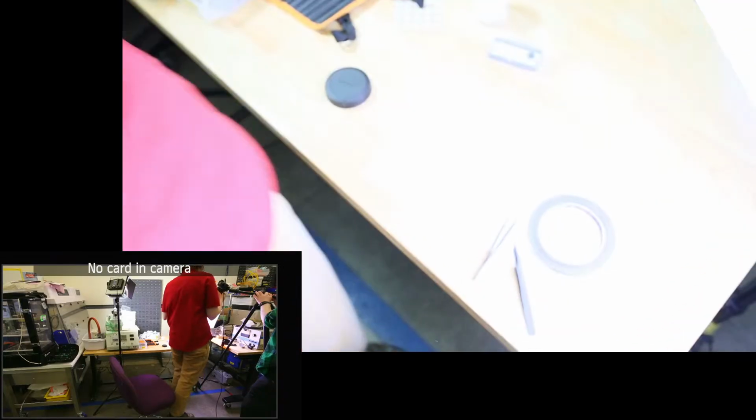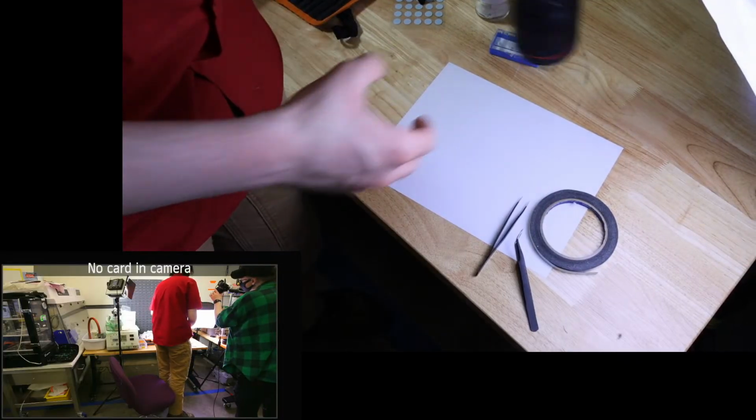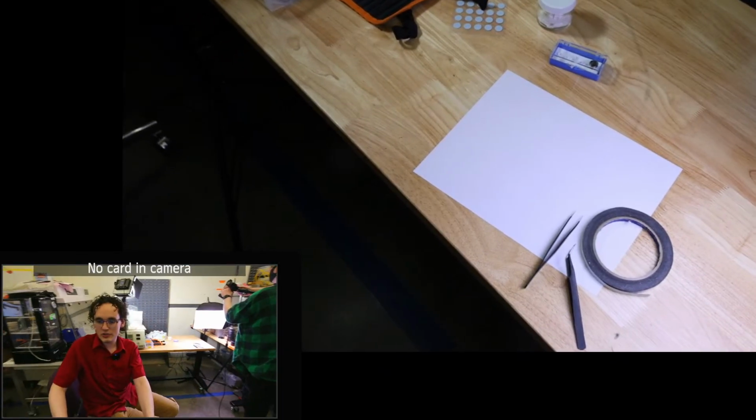So now we're going to switch back to our other lens here, and we're going to go ahead and load lock our sample out. Does that sound good? Yep. And you're in autofocus. Okay, do you want to pan over to the microscope and we can do our sample exchange?